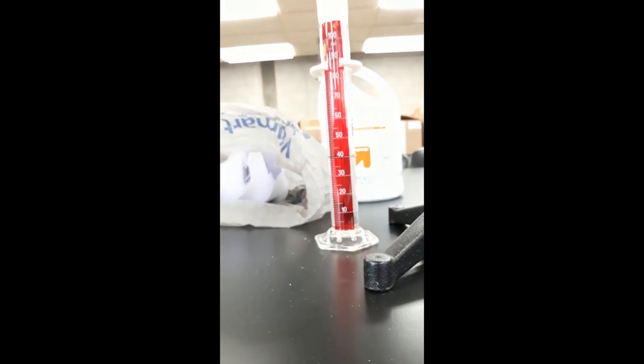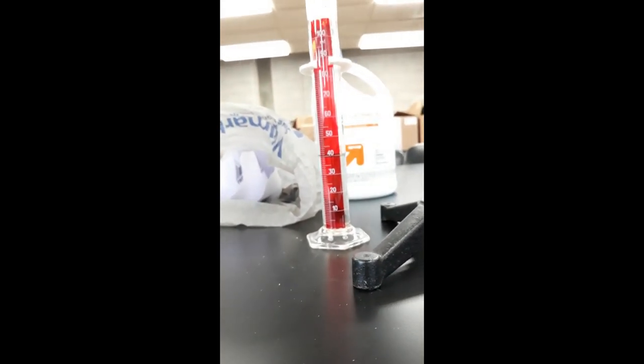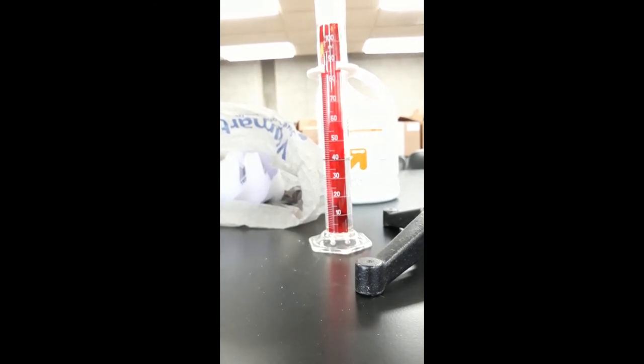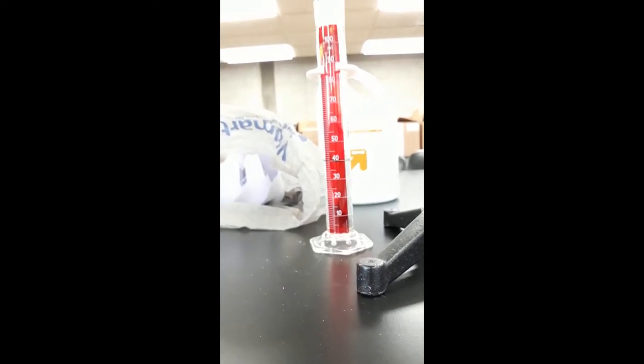Okay, now this is the reading with 0.1 mils after five minutes.